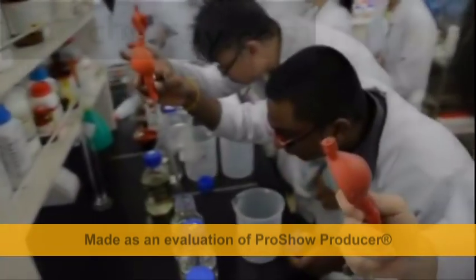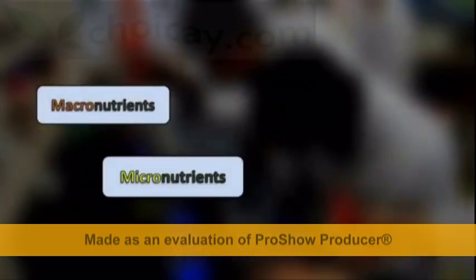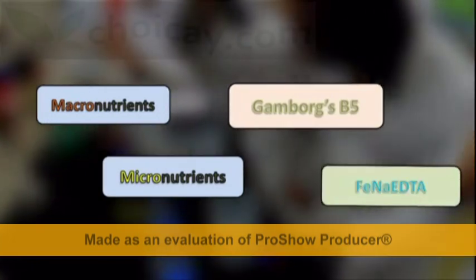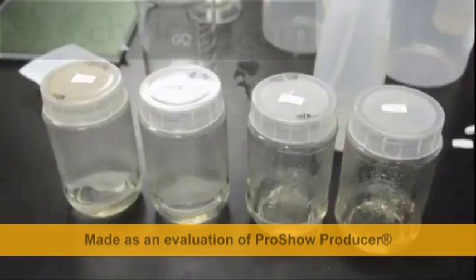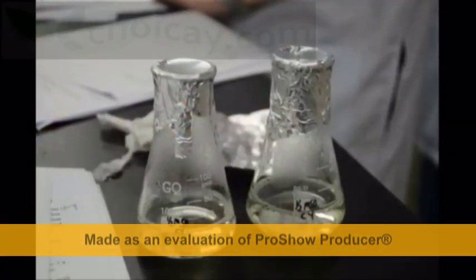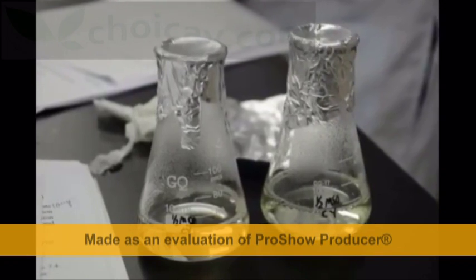Firstly, there is the preparation of MS medium for seed germination, which is made up of macronutrients, micronutrients, vitamins, and Fe-NAEDTA. After mixing all ingredients, the half-MS liquid medium is then microwaved and autoclaved. After solidification of the culture agar medium, it is ready for inoculation.